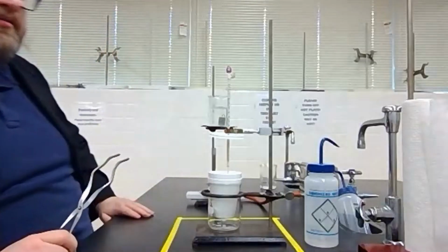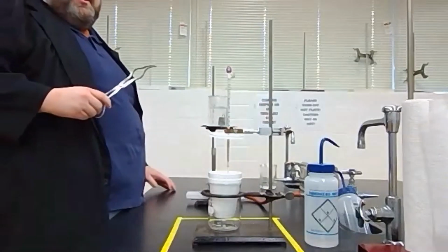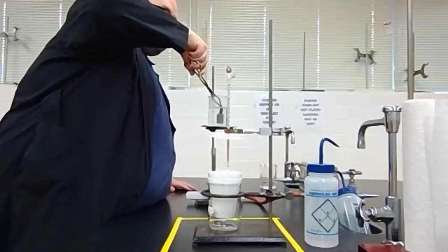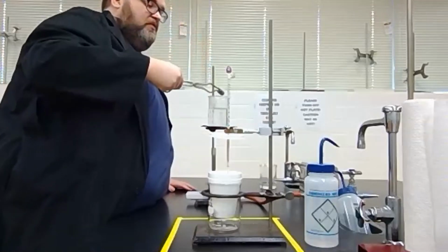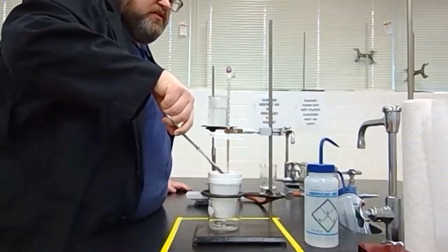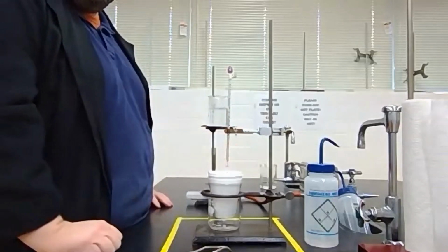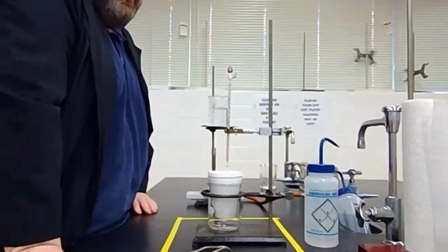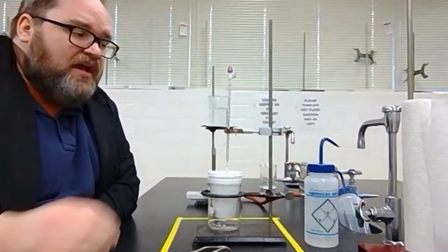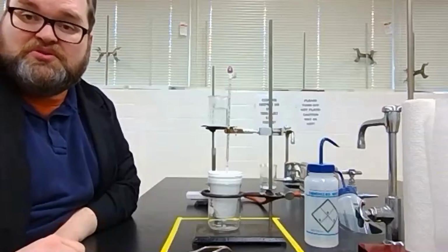So now let's do this, very dangerous. We've got 100 degrees Celsius. So I'm going to knock off this water. To monitor this thermometer for 3 to 5 minutes, checking it every 20 seconds to see what that max temperature is going to be.